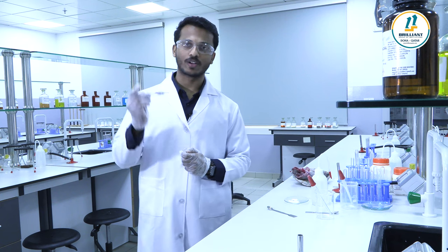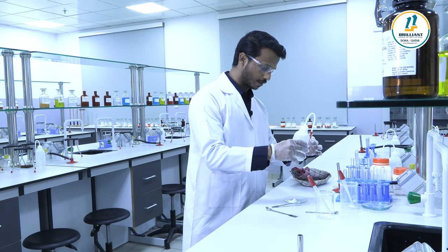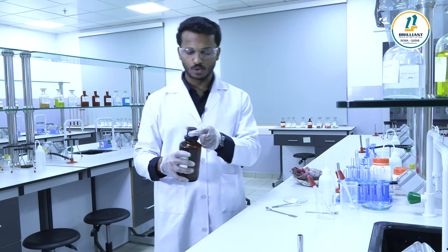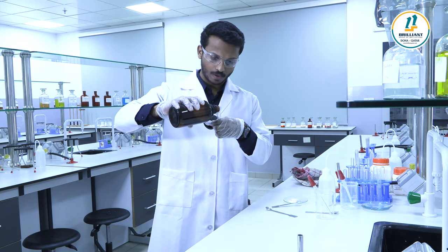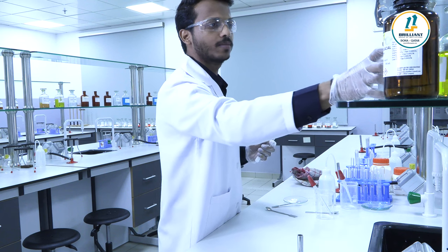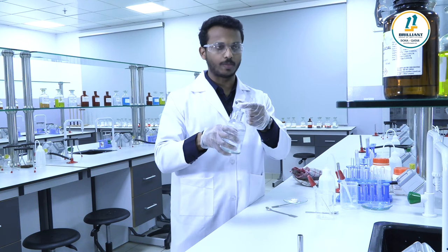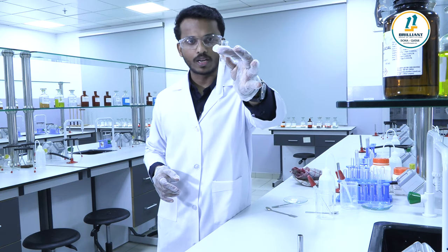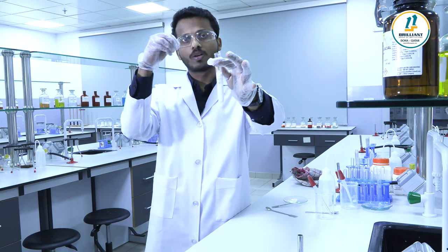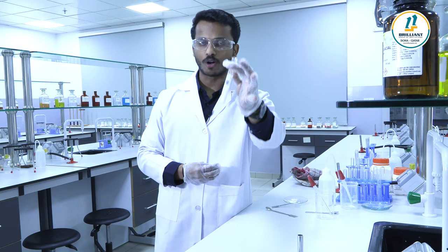Confirmatory test for the group five cation calcium. To a little of salt solution, add 2-3 drops of concentrated acetic acid, then add ammonium oxalate solution. You will get a thick white precipitate of calcium oxalate, which indicates the presence of group five cation, calcium.